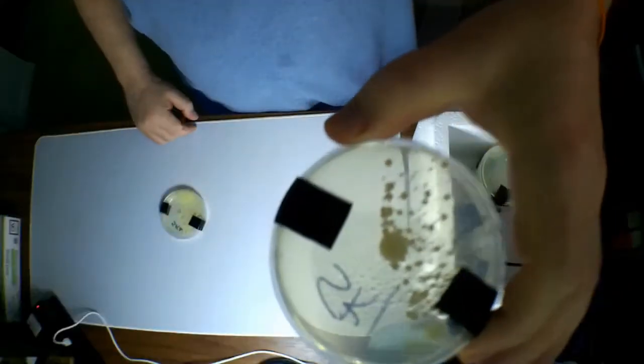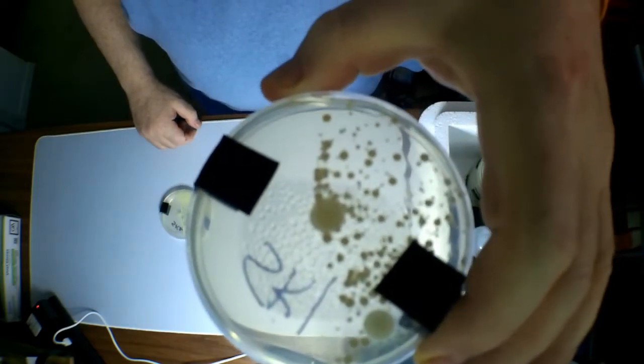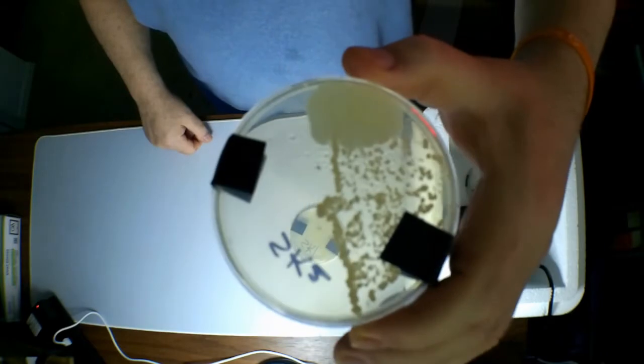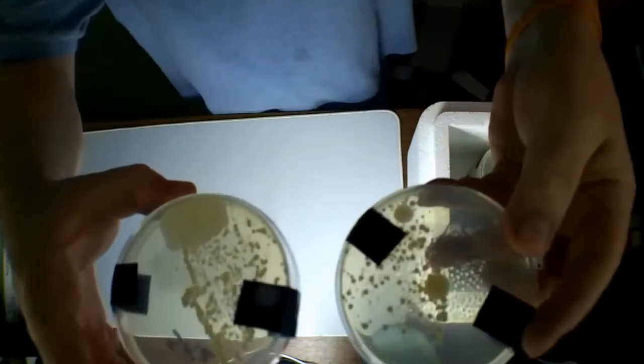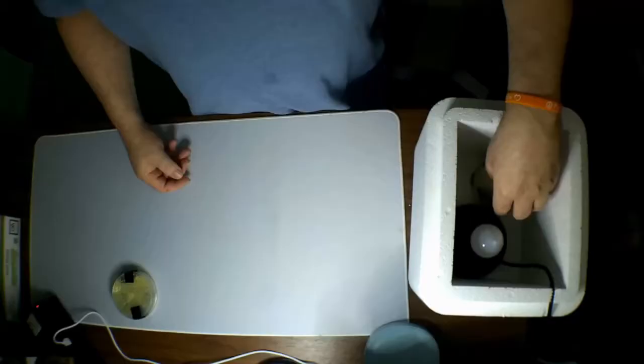Alright, here we have sock number 1. Clearly has growth there, as you would expect. Not terribly a lot of growth. Here's sock number 2. That is a lot of growth, and not a lot of dead bacteria as we were thinking. Very similar. So, it looks like, from my perspective, for the socks, it didn't do very well.